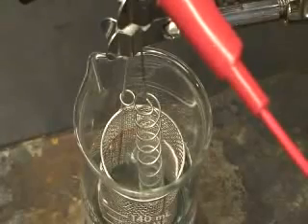Bubbles should be produced at the anode flowing to the cathode. Note if the wires are switched this flow would be reversed.